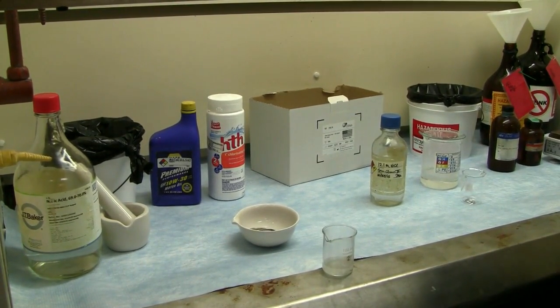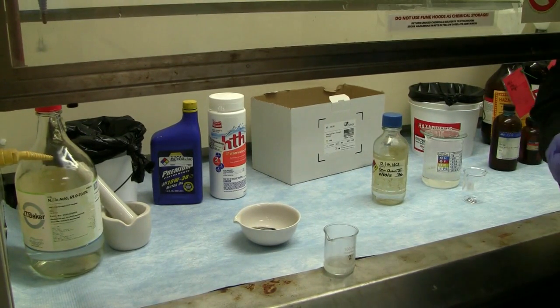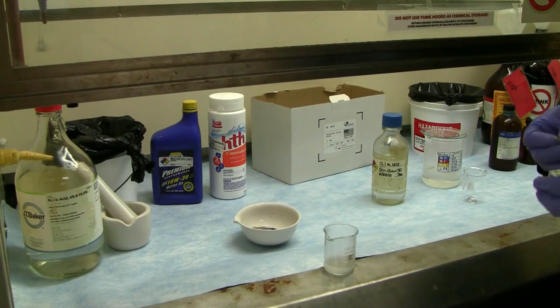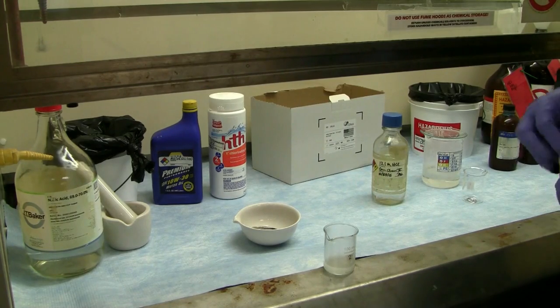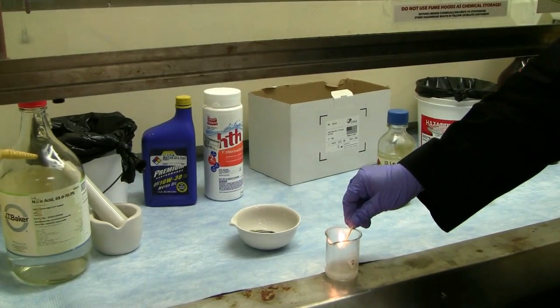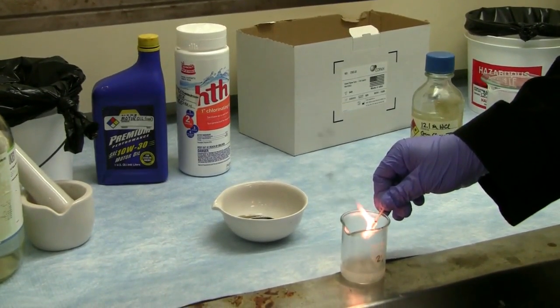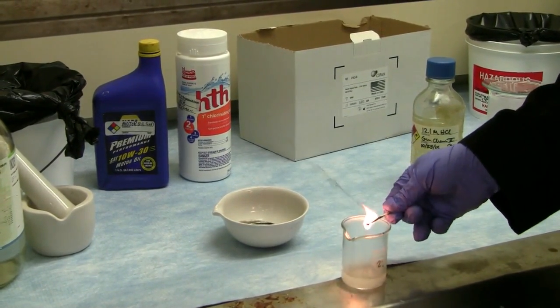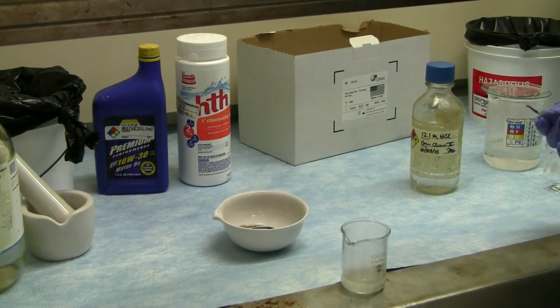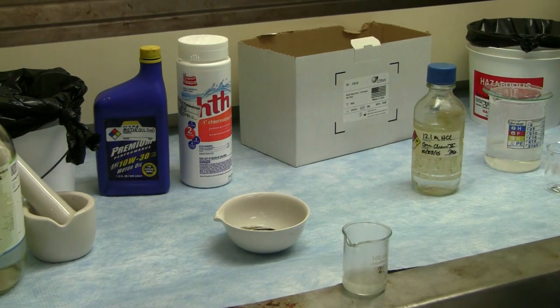Now of course whenever I'm doing this, I'm wearing double gloves. We're doing this in a controlled environment with a vent hood. And you can notice we've got sorbents all around. We're ready for whatever comes towards us. And just for a little extra added fun, see the advancement of the flame due to the addition of the hydrogen gas in there. So there's a little bit of extra fire coming from there because of the hydrogen gas. Normally the match wouldn't burn quite so vigorously without it.